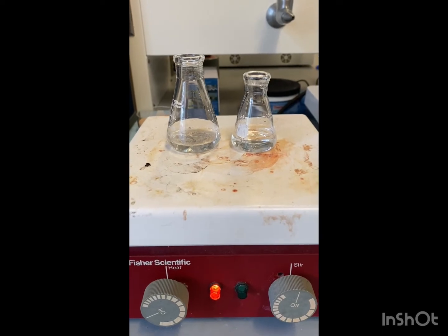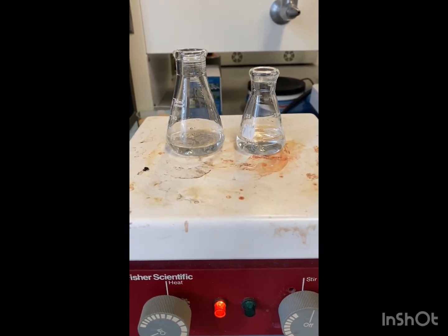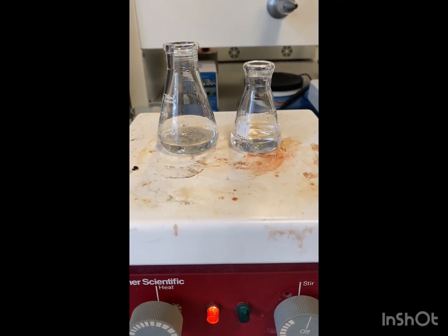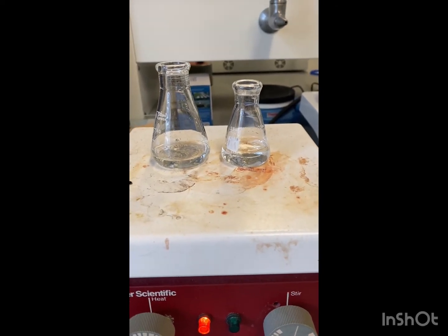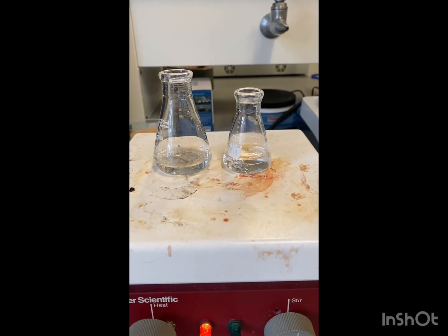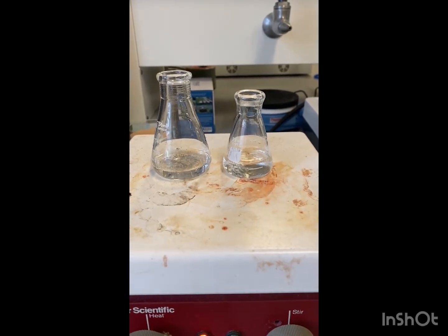You can also add boiling chips to the benzoic acid in water, but we're just going to heat this and let it get to a boil. While that is going on, we're going to set up gravity filtration.